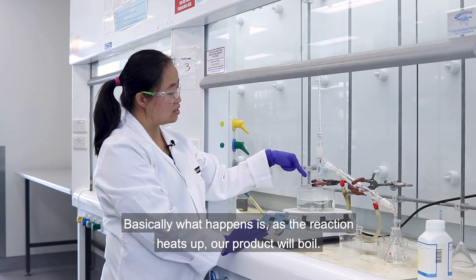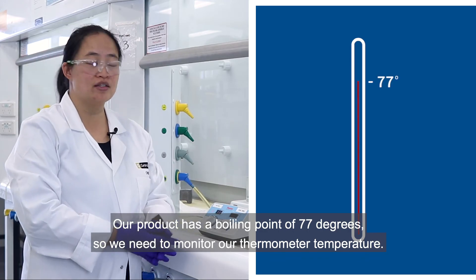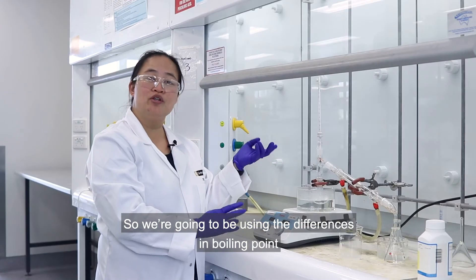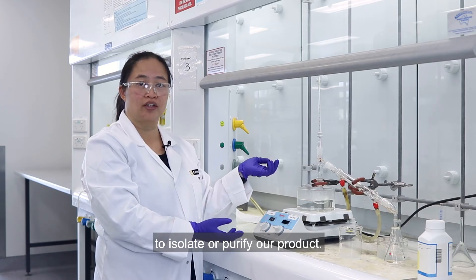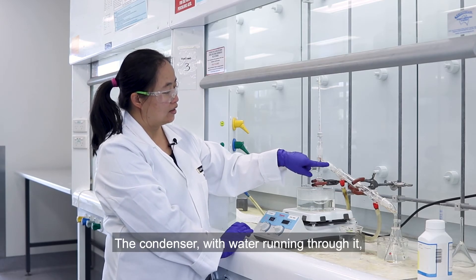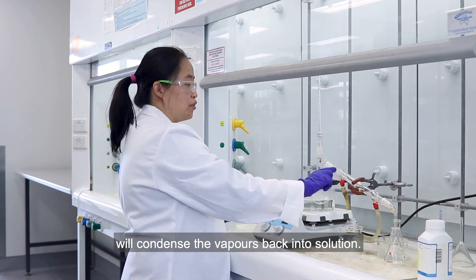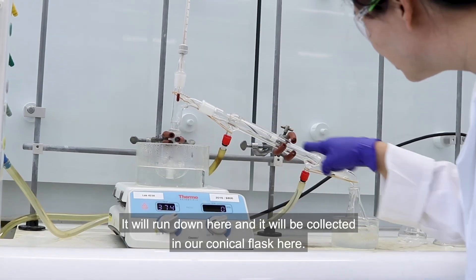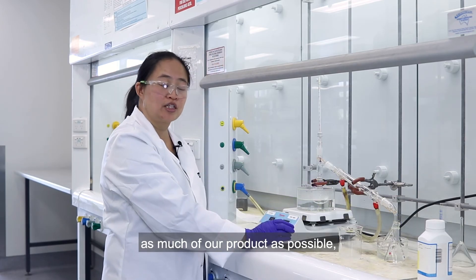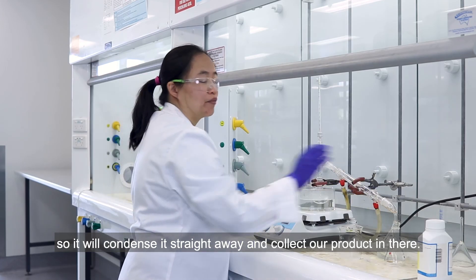As the reaction heats up our product will boil. Our product has a boiling point of 77 degrees, so we need to monitor our thermometer temperature and we don't want it getting above about 80 degrees. We're going to be using the differences in boiling points to isolate and purify our product. The product will boil first, producing vapours that rise up to this point. The condenser with water running through it will condense the vapours back into solution. It'll run down and be collected in our conical flask. We also have an ice bath to collect as much of our product as possible, condensing any residual vapours straight away.